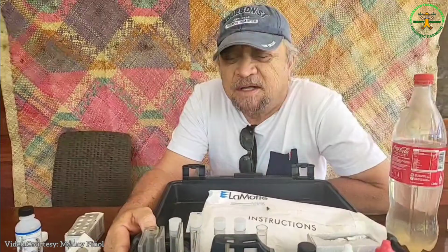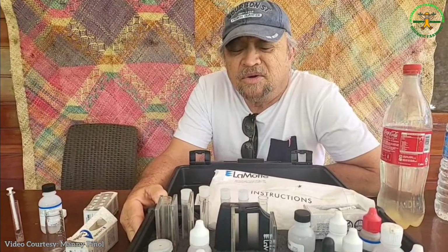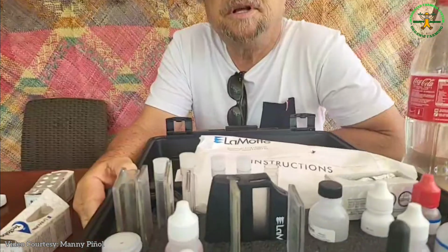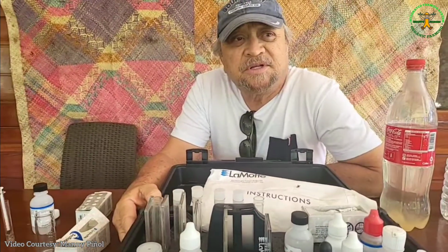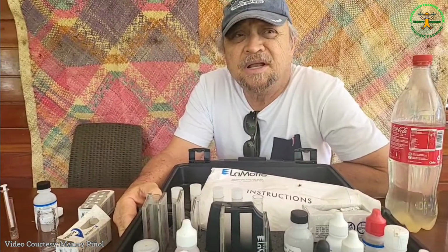Well, alkalinity really is one of the simplest and most important tests that you want in a freshwater source. The reason is you want to know the amount of calcium carbonates in your water, which has a direct effect on hatchery operations and culture of freshwater fish.